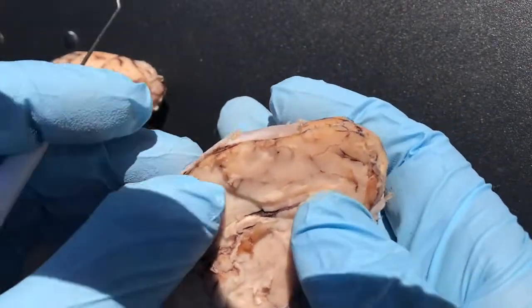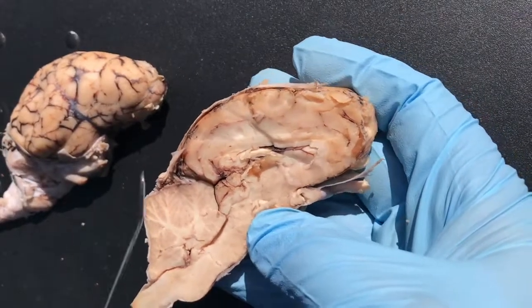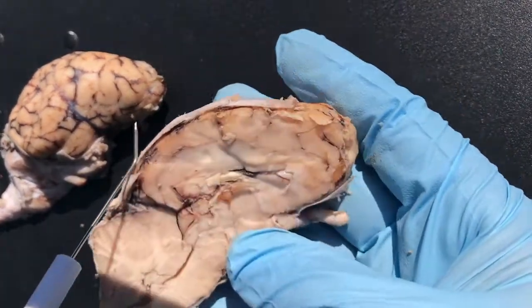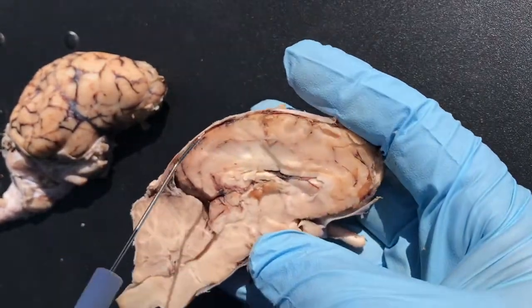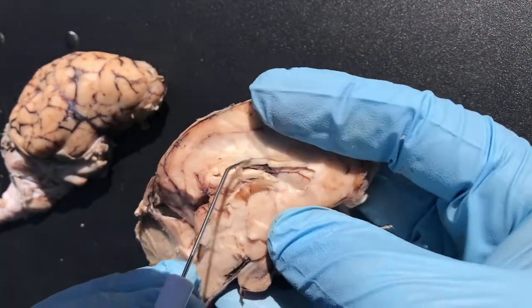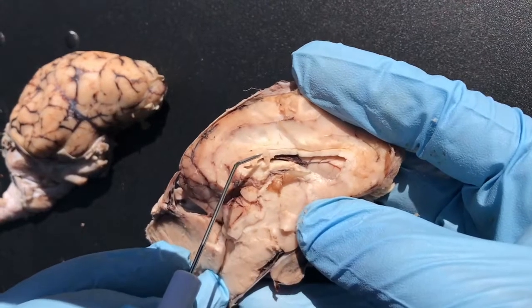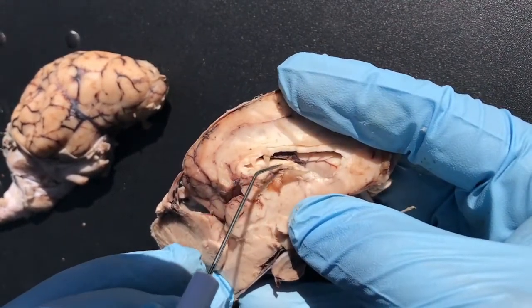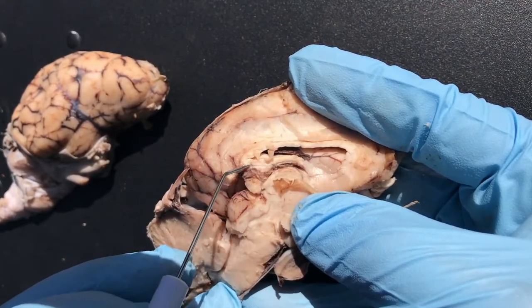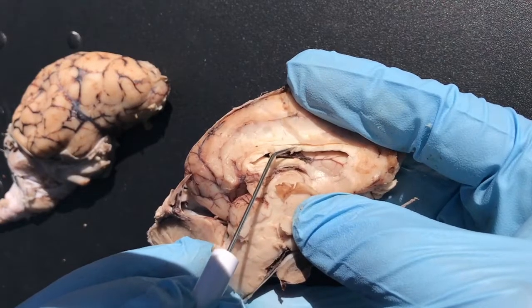Let's just take a look one more time and go through some of these terms and see if we can identify all of them a little bit quicker. So here's your left cerebral hemisphere — this is all the cerebrum on the outside, and that's made up of gray matter. And first thing I notice here is you have your corpus callosum. See all this white on the outside right here — this is your corpus callosum. And the other border on the bottom here, that's your fornix. And as you go up, that's your corpus callosum.